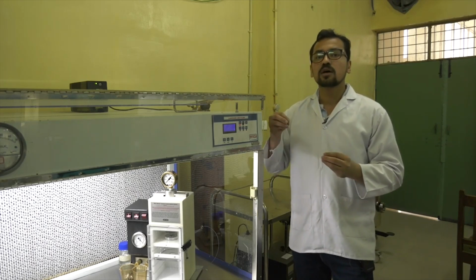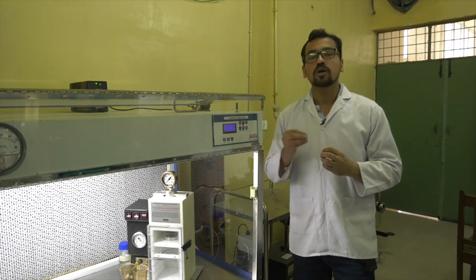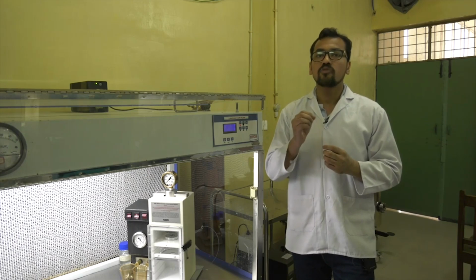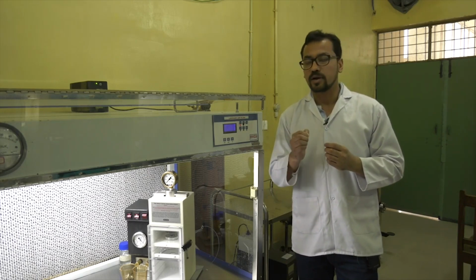It means that it is projected onto the callus with lots of pressure or force, and then these gold particles insert inside the plant callus, where they integrate with the genome of the plant or the callus. Now we will take this callus and it will go through a process similar to that of the biological transformation. So it will go through the process of selection, then regeneration, then rooting, and further hardening.